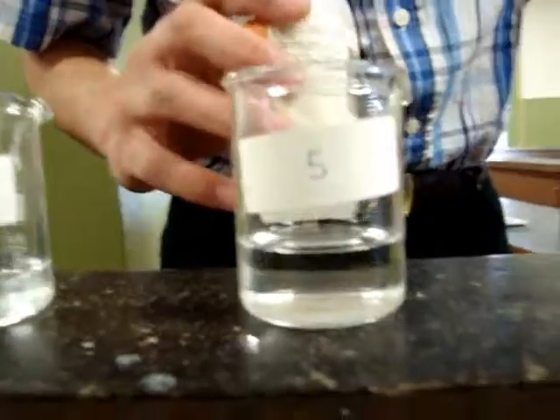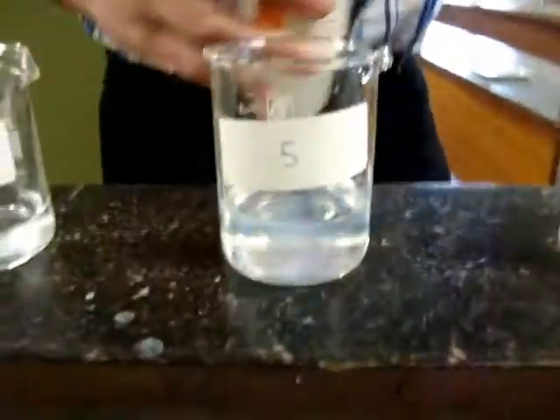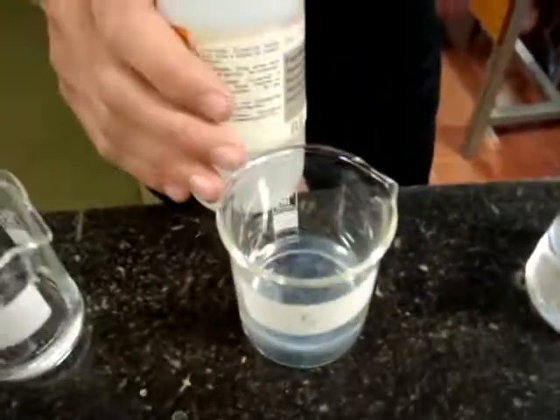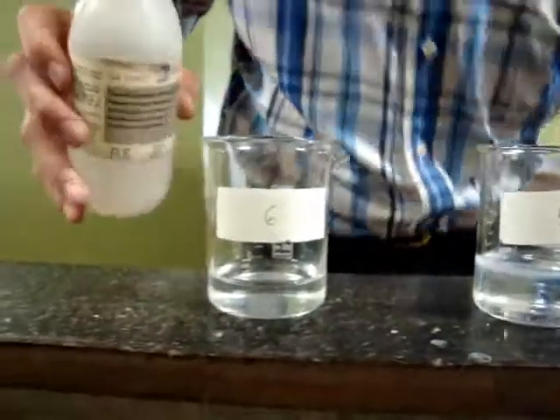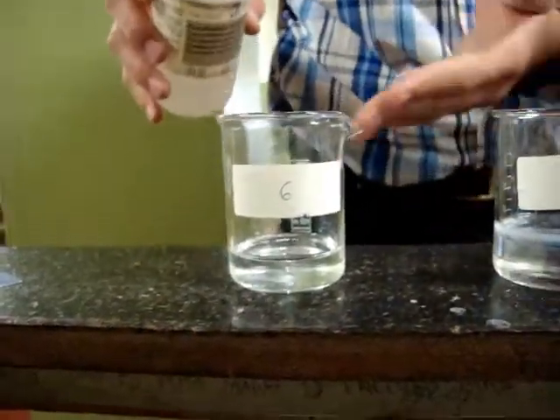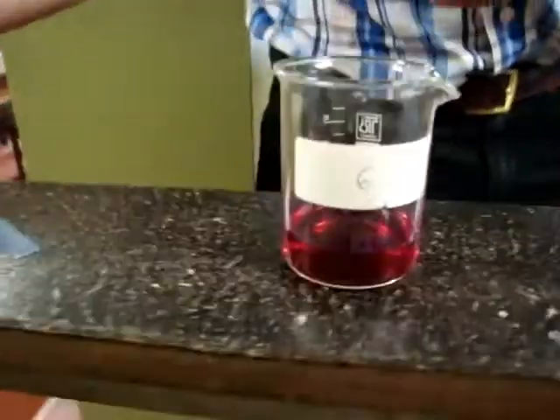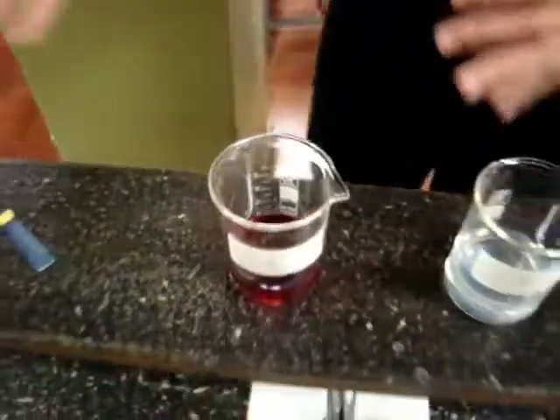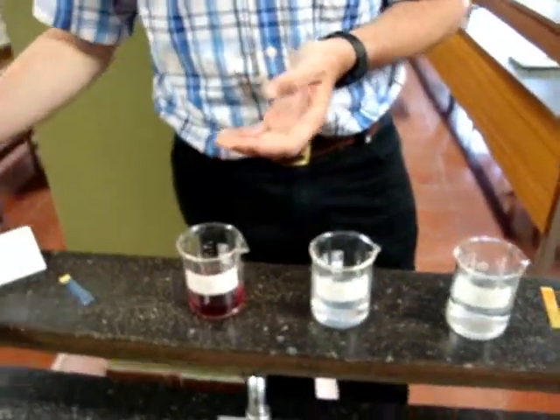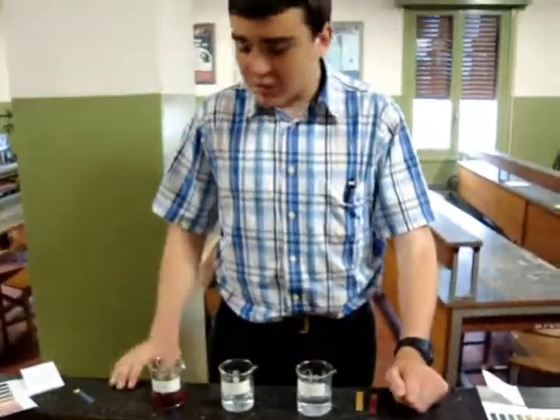With the neutral water at pH 7, it becomes nothing — it is also a bit white, there is no difference. And with the base, we have a very nice pink color, this fuchsia. It is a very nice color, and it is a good way to determine whether a substance is basic or acid. So that's all.